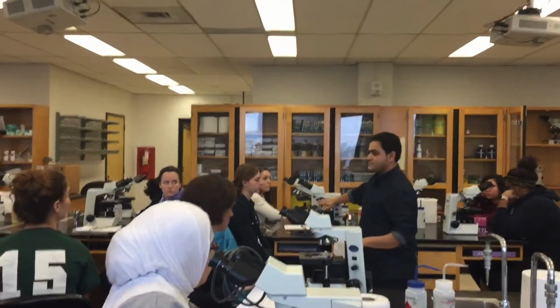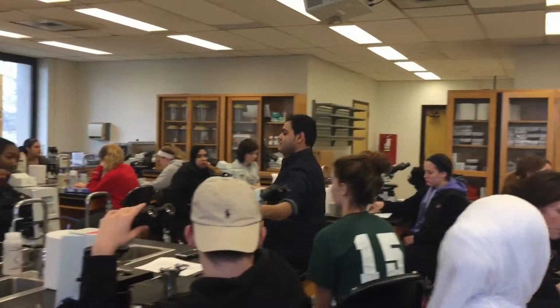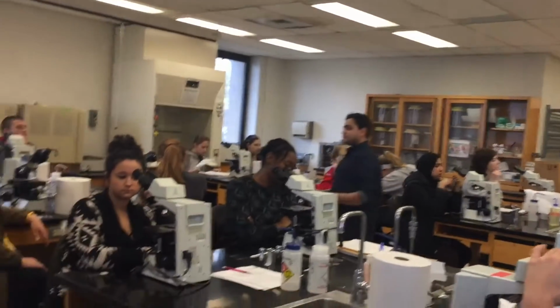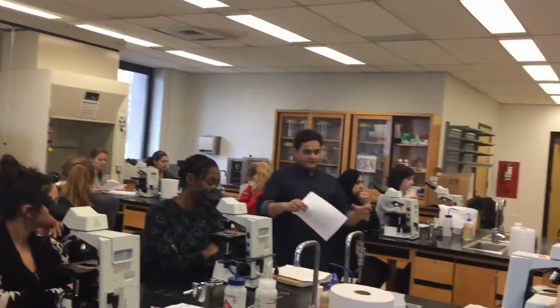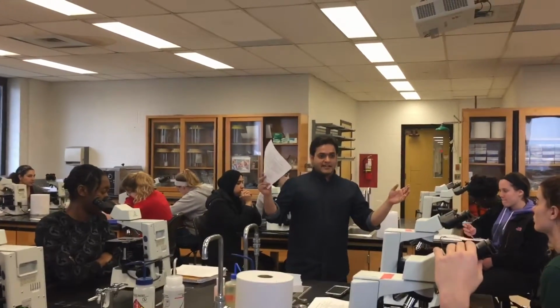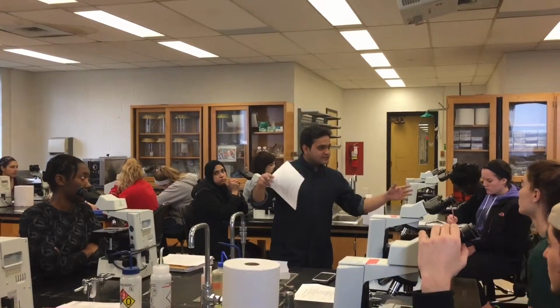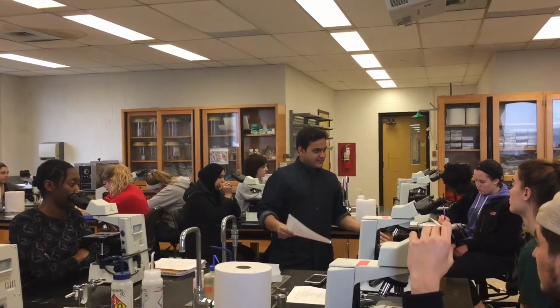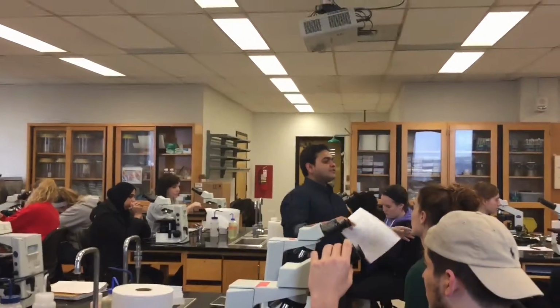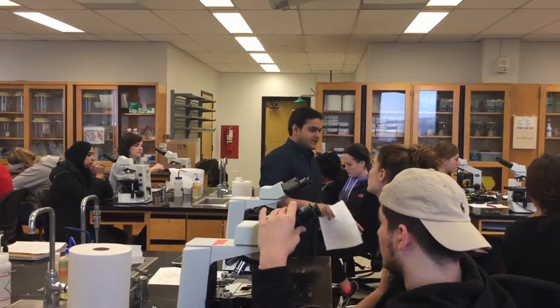This is called objective magnification. The different objective magnifications are 4x, 10x, 40x, 100x. So what is the difference between 4x, 10x, 40x? It's kind of magnifying it, basically. It's like a satellite image, for example. If you're looking at Cleveland in the first place, then we look at CSU, then we focus at this classroom. Did that make sense? So the 100x would focus on this classroom, 4x will focus on Cleveland, and 40x will focus on CSU, for example.